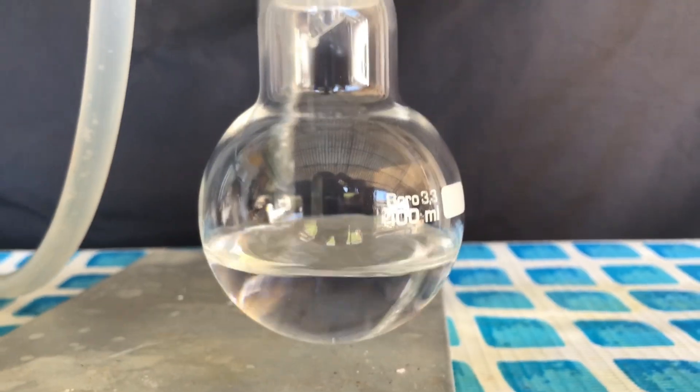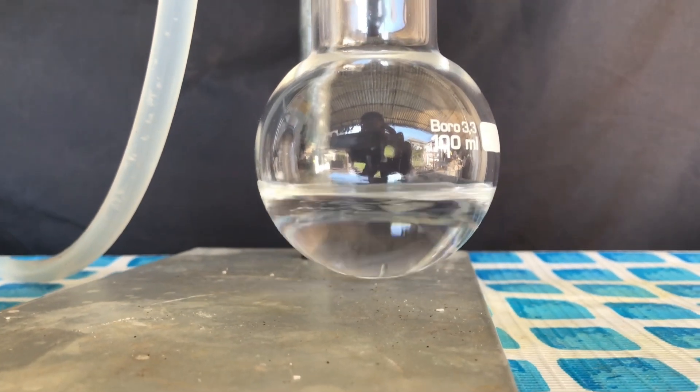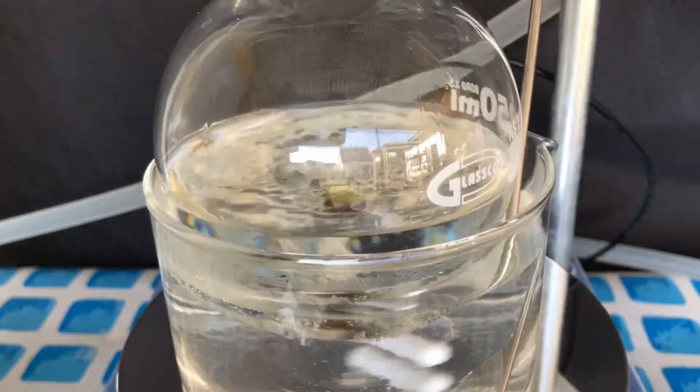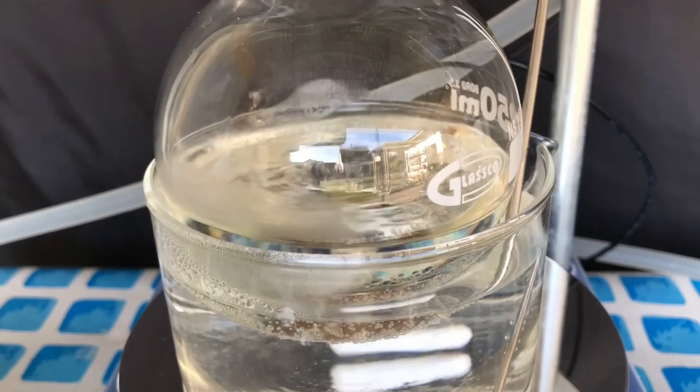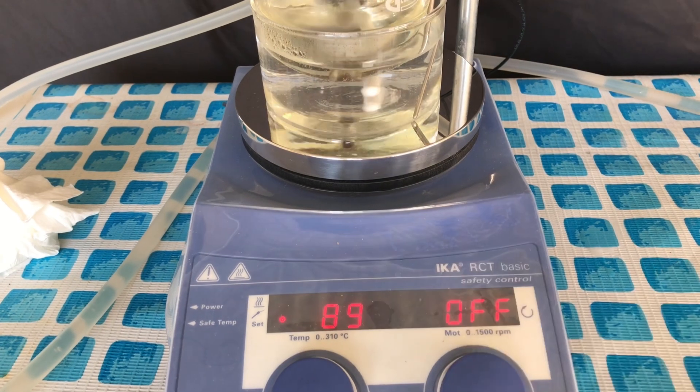Dichloromethane starts to boil at around 40 degrees C and therefore it starts to boil very fast. After about half an hour, no more dichloromethane was coming over and the hot plate and stirring were turned off. If there's no solvent left, why isn't there any solid yet?